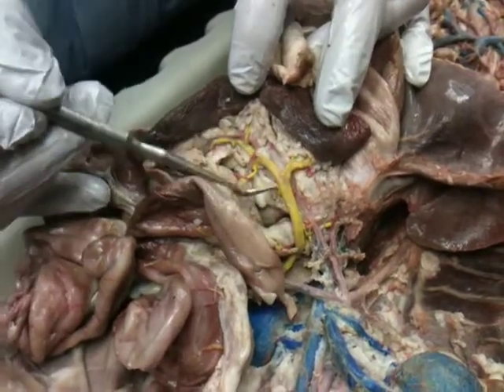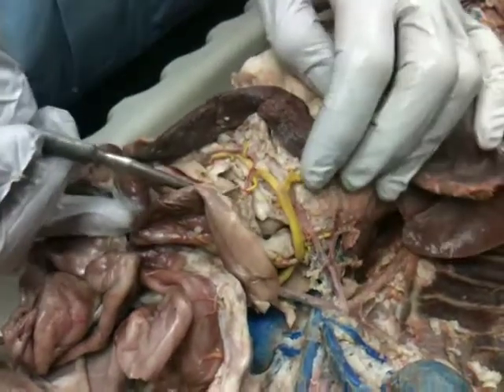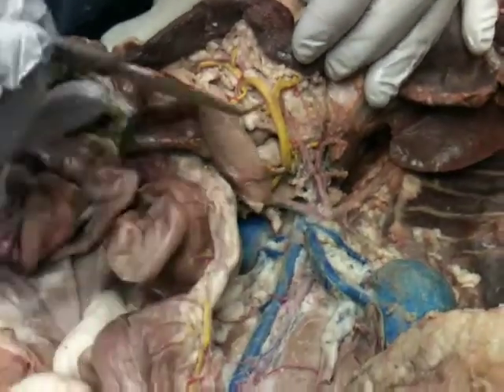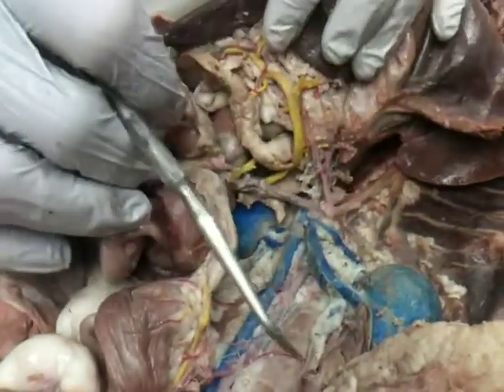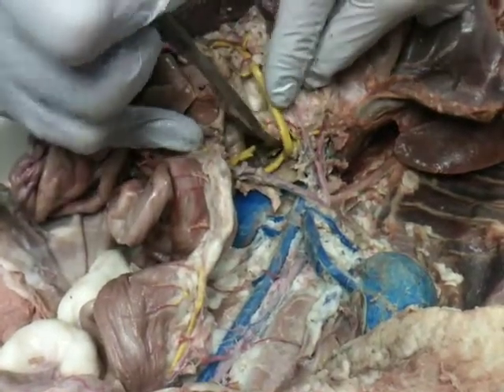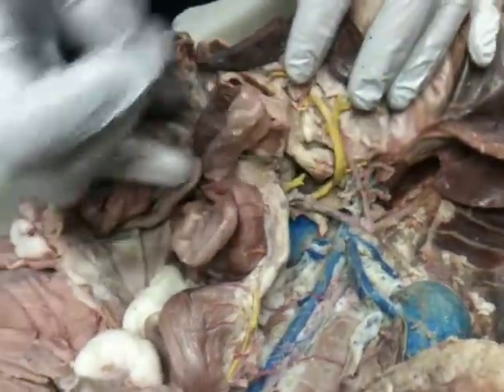That's real clear on this one. Anytime you have a question, look to see where it's going. It's going over to the spleen. Probably the splenic. If it's closer up toward the medial, it's probably the gastrosplenic, at least of the vein. Here it might be the celiac. So celiac artery there. Wait, which one's the gastrosplenic? Would be this guy right here, vein. Gastrosplenic. And I'll flip it over and look at it a different way too when we get to the hepatic portal system.